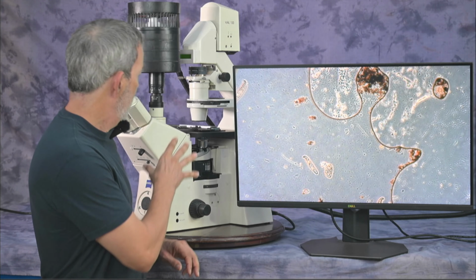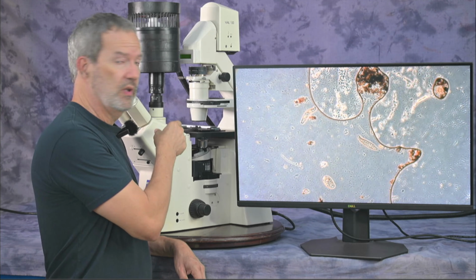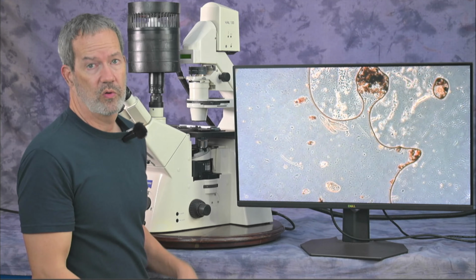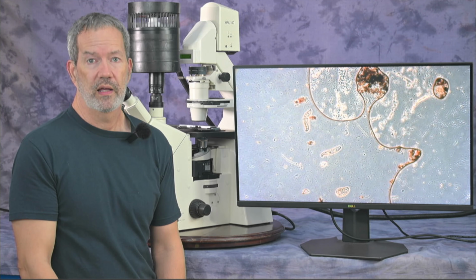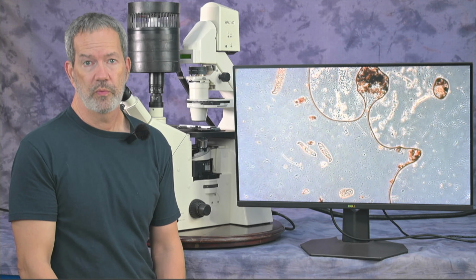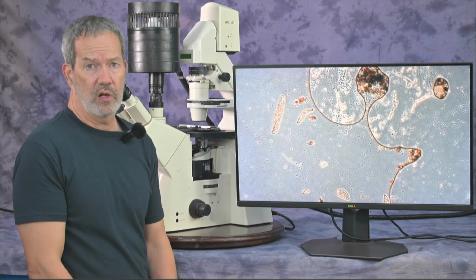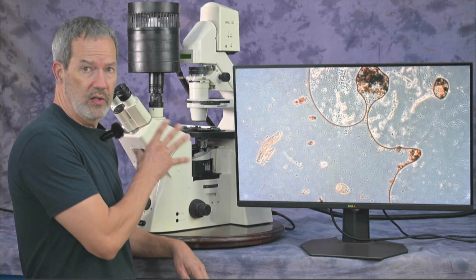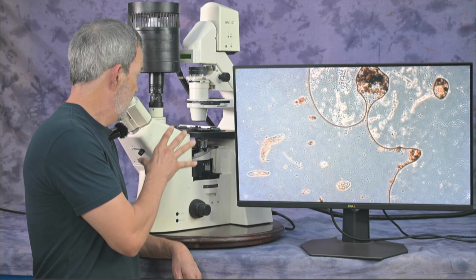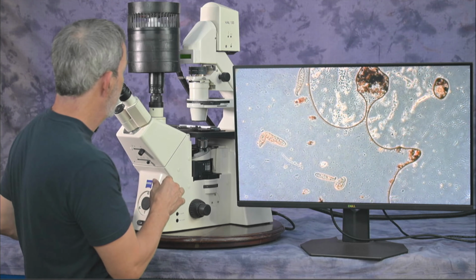By the way, we're going through a 1 millimeter thick glass. So this is going to be equivalent to a glass Petri dish. We are not going through a cover slip thickness, 0.17 millimeter thick. That makes a huge difference. If you're going to just do slides and go through the cover slip thickness, things would be different. These objectives are all configured at the moment for a 1 millimeter thick. Okay, let's get right to it.